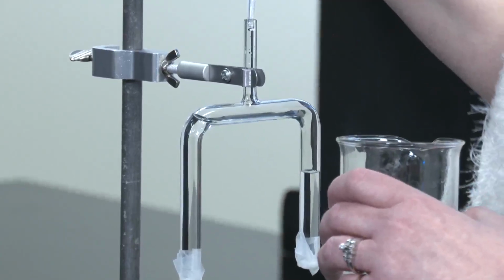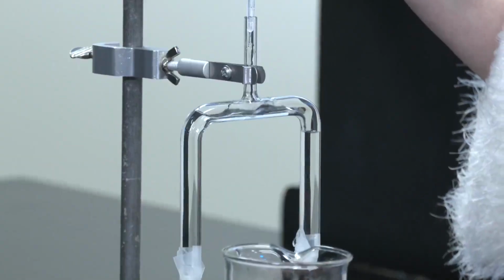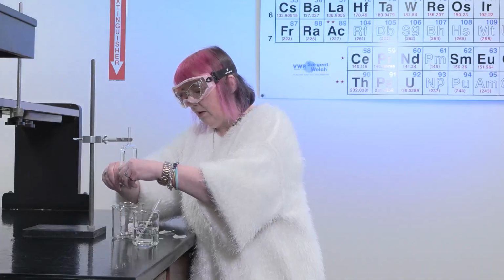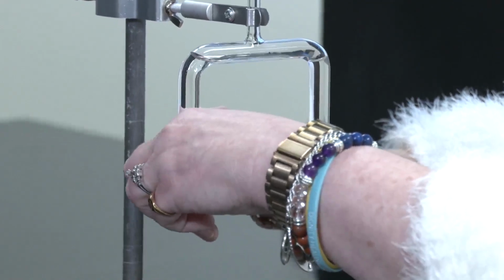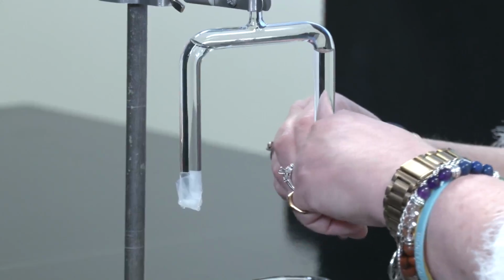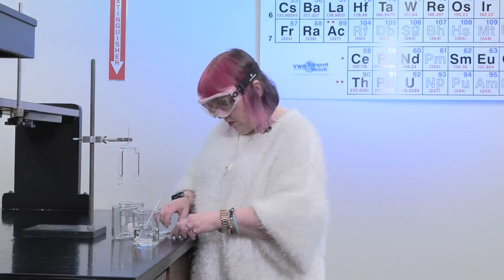And yes, it takes a very long time to do it this way, but if we were to pour directly from a beaker, that would go too fast. And I am leaking, so you can see what I mean about this needing to be parafilmed fairly well. A small leak in this when we're setting it up is not that critical. So we need to get this the majority of the way filled.